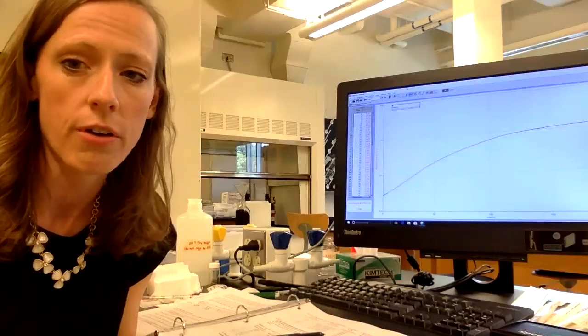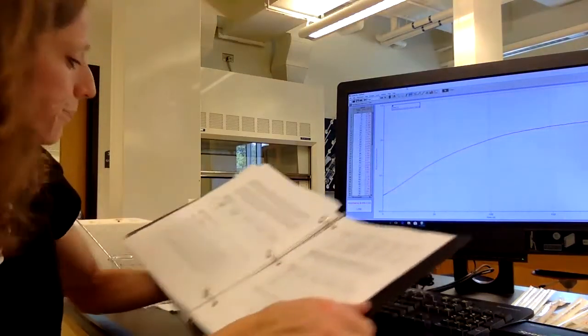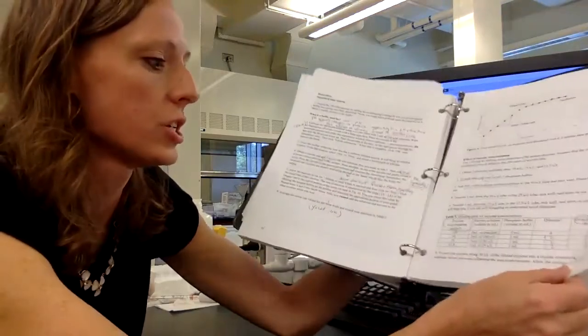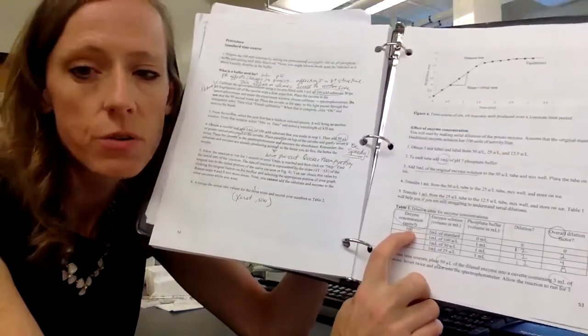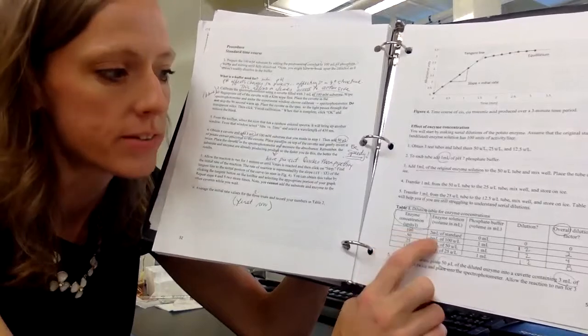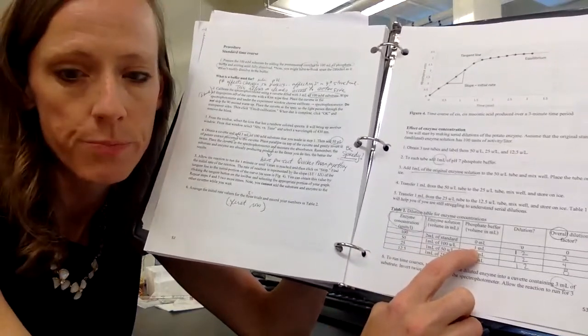And then when we progress and we dilute that, the dilution that you will do, I'll just show you here, on the previous page, is you take 1 milliliter of that full strength enzyme that was taken directly out of the potatoes, and you mix the 1 milliliter of that with 1 milliliter of phosphate buffer, okay?